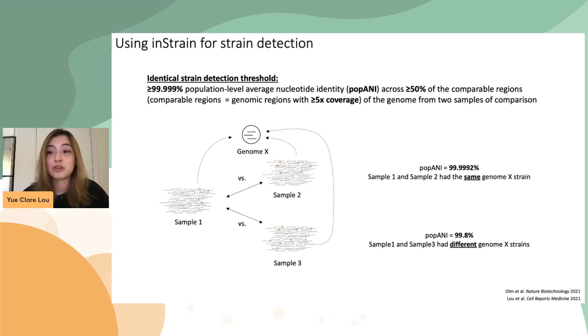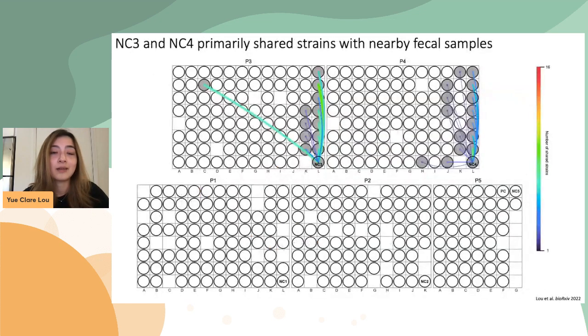Once we found all shared strains between fecal samples and negative controls, we visualized such strain sharing patterns in the context of DNA extraction plates. And this is what we saw. For P1, P2, and P5, all the negative controls on these 3 plates never shared any strains with any fecal samples. However, NC3 and NC4 only shared strains with samples extracted from the same plate. And as you can see, there is some sort of proximity-based strain sharing pattern going on.